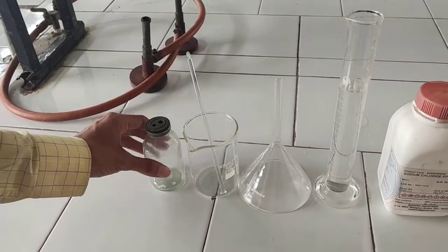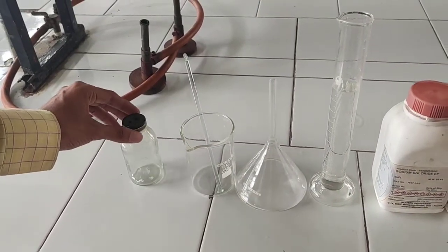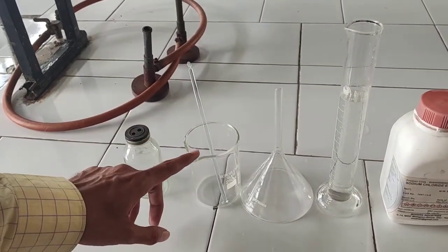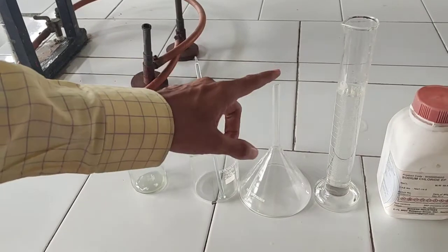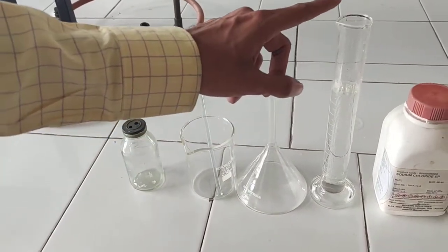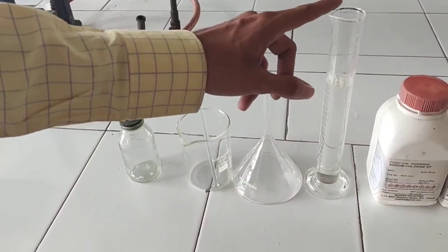These are the basic ingredients for 5% dextrose solution preparation. We have a beaker of 250 ml, a stirrer, and a filtration funnel.